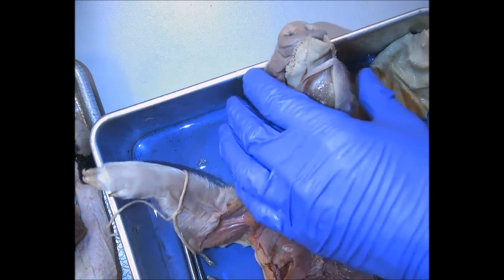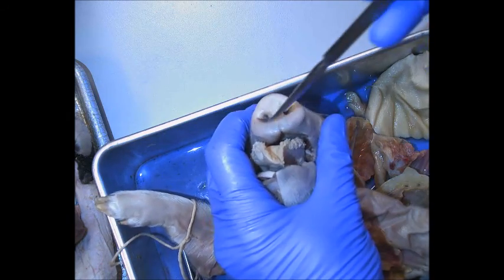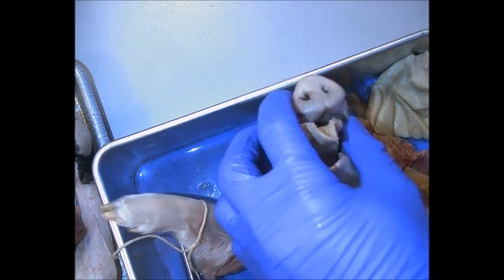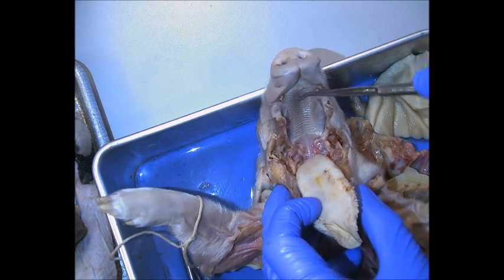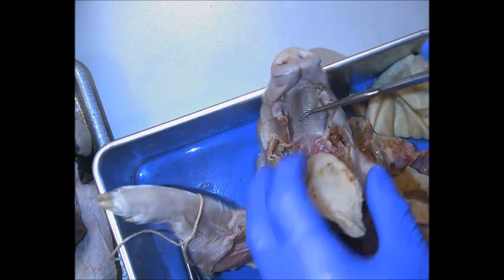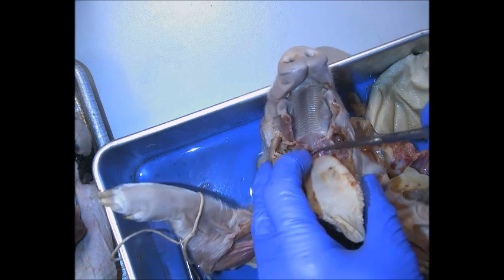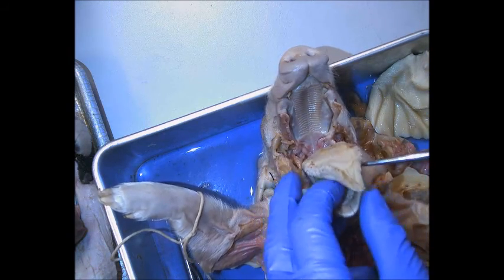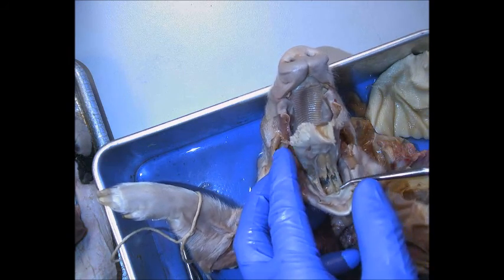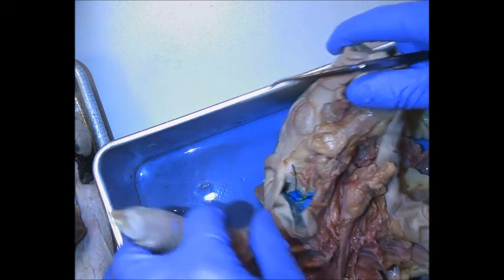For the digestive and respiratory system on the pig, you'll see the external nares — the external nose holes — the tongue. You have the hard palate where you see the ridges, the palatine bone, palatine process, and the soft palate in the back. You have canine teeth. Beneath the tongue, you'll be able to find the sublingual glands, or the sublingual salivary glands.